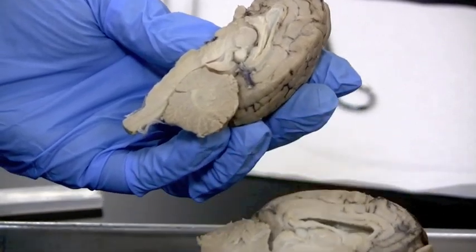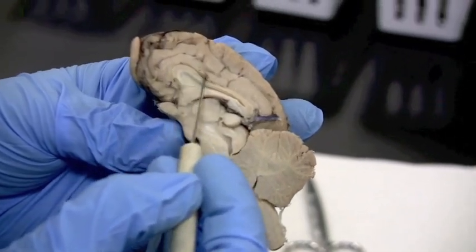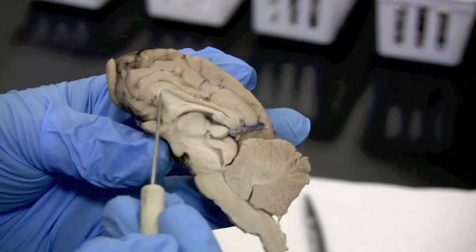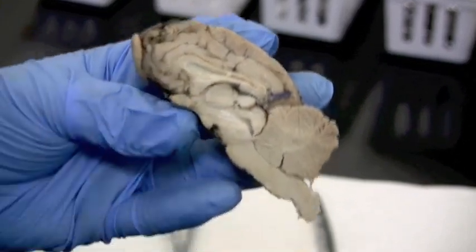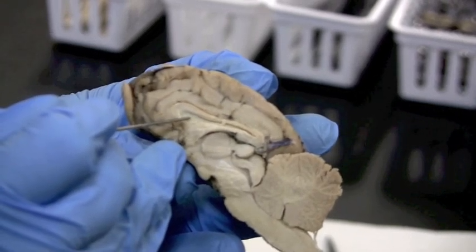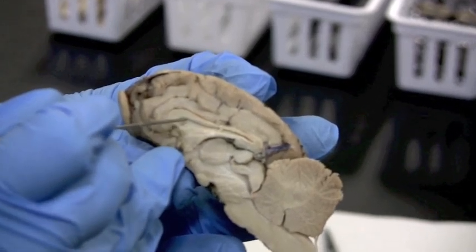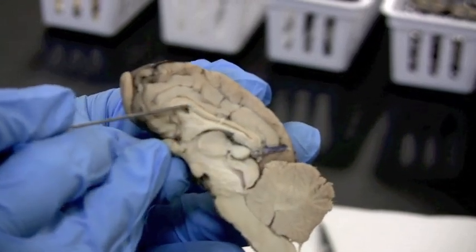We've got two good halves. The corpus callosum is a really good landmark right in the middle — this arch that comes up here. Following it like a circle, the inferior portion is the fornix, but the top is the corpus callosum: the fibers connecting the two cerebral hemispheres. This thin membrane covering the hole is the septum pellucidum — the partition between the two lateral ventricles, left and right. There are little holes in it called the interventricular foramen that allow cerebrospinal fluid to pass through. It's just a very thin little membrane.